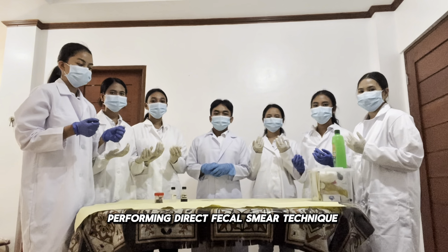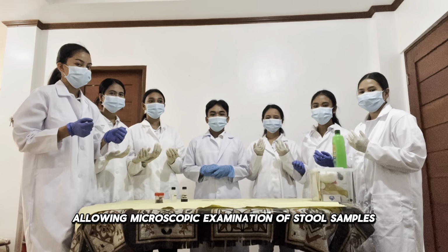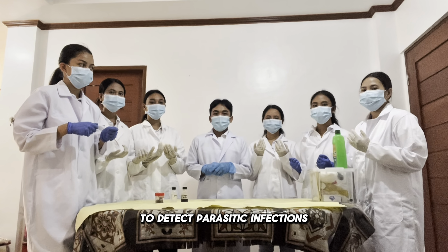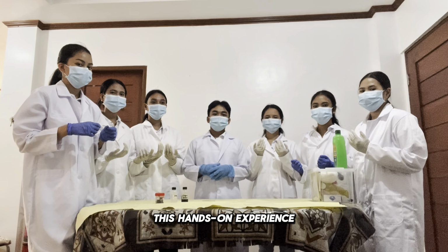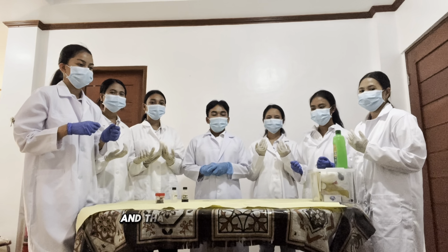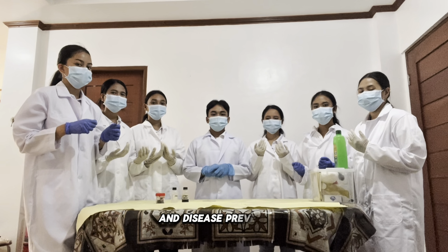Performing the direct fecal smear technique is a fundamental skill for us nursing students, allowing microscopic examination of stool samples to detect parasitic infections, undigested food particles, and other abnormalities. This hands-on experience reinforces proper technique and infection control, and that will help us in patient care and disease prevention.